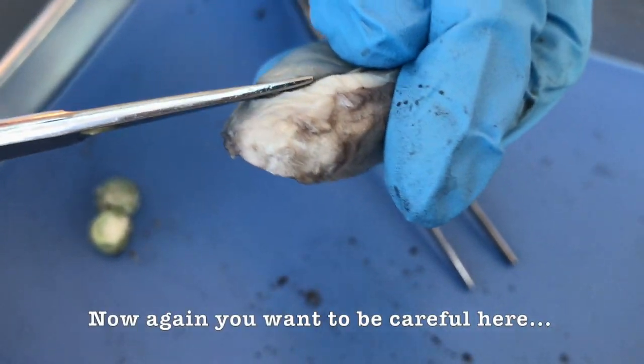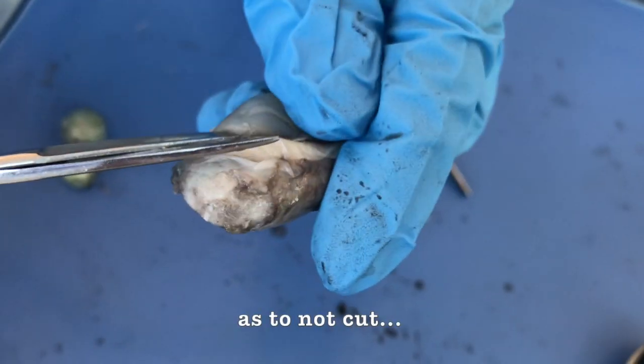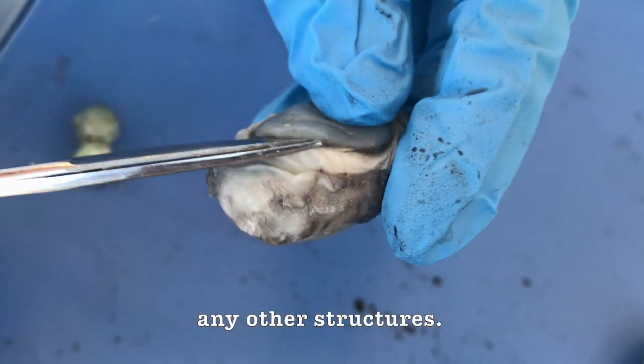Now again, you want to be careful here as to not cut any other structures.